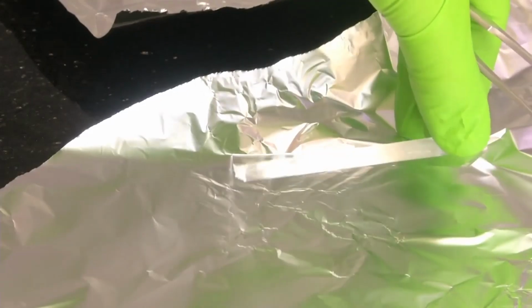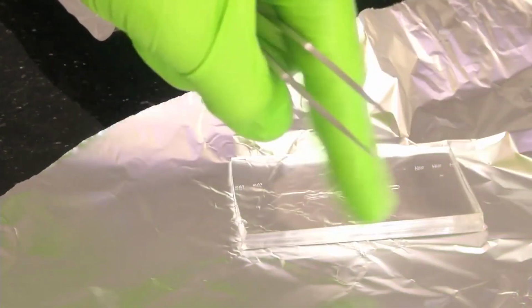So students, I think now you have got a very good idea of how, using a microfabricated silicon master, you can make a good, nice, thick PDMS membrane like this with your microchannel in it. This is a very important process in microfluidics fabrication, and it is very important that you know every single step and the importance and purpose of each of these steps in the whole process. So once the PDMS membrane is ready, as I have told, you can stick it onto a glass slide or a silicon wafer that may or may not have sensors. They may have electrodes, or they might be pure optical analysis based devices.